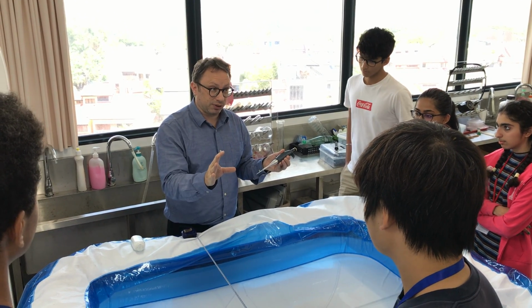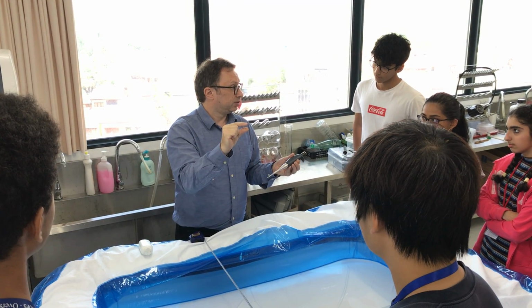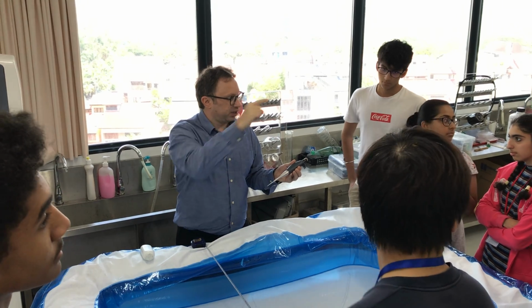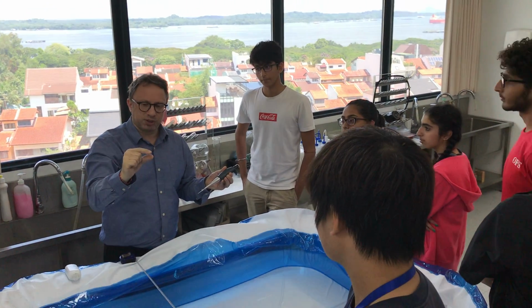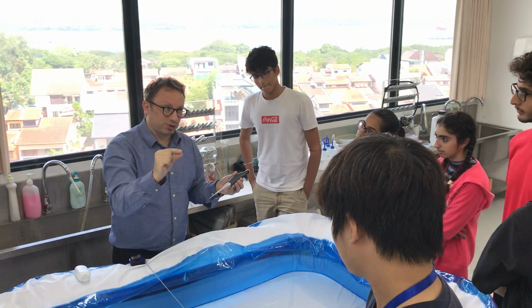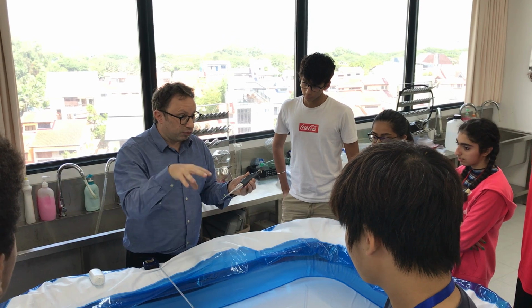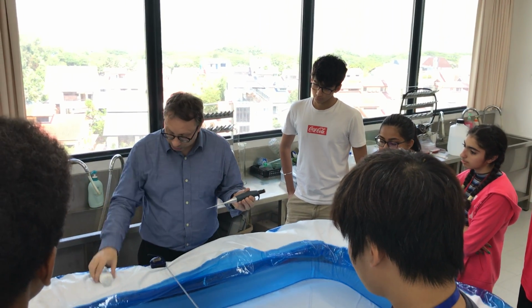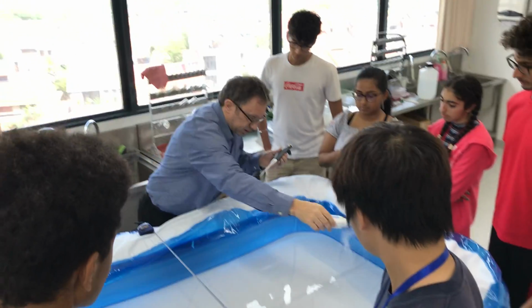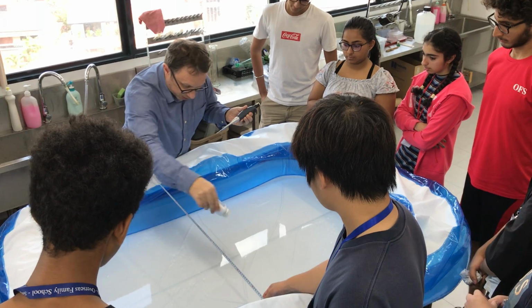Now, we're going to try and take some measurements, and then you are going to try and work out the calculation, so you'll know the volume of the drop. I think I've got the wrong volume on there, so we'll go and correct that in a minute. So the volume of the drop, and we should have the diameter of the area of a puddle of oil floating on the water. Now, before we start, we're going to shake some of this on, which is going to help us visualize our oil a little bit.